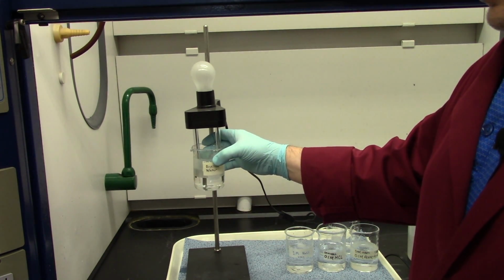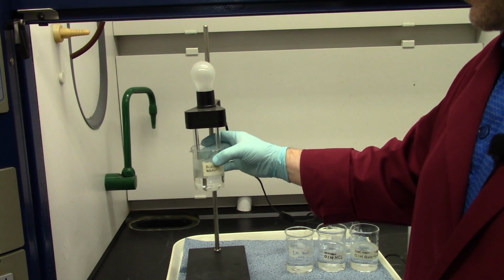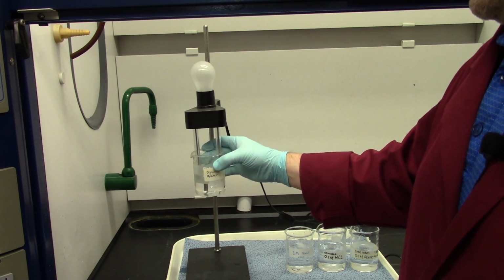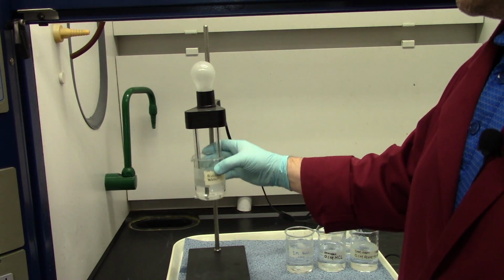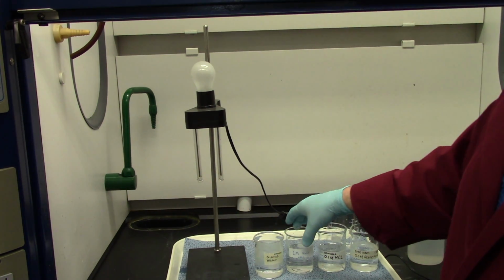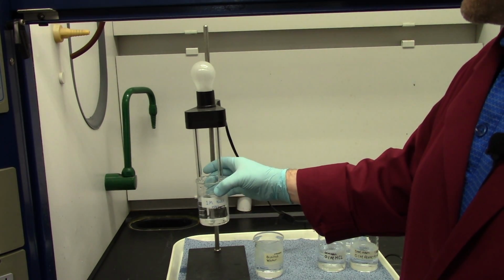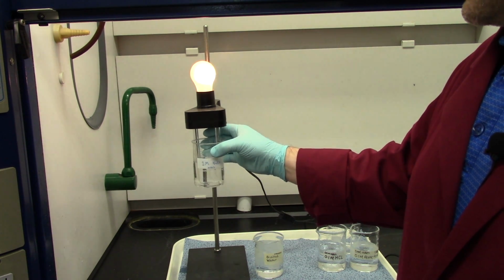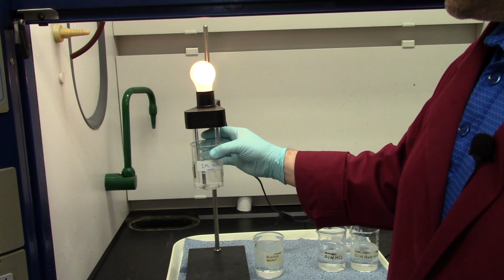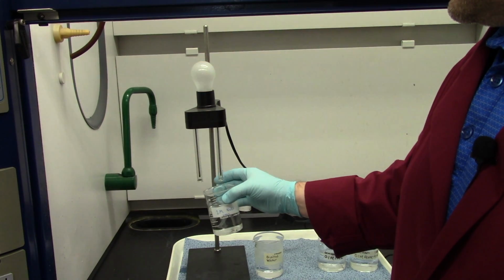Water, as you can see, by itself, doesn't conduct electricity, at least in this experiment, at all. Now, if you put enough energy through water, it will conduct electricity, but it takes a lot. All right, guys, so water is a non-electrolyte. Next, 1 molar sodium chloride. Let's see what happens. Oh, look at that. Bright, bright light. Sodium chloride dissolved in water definitely conducts electricity. It is most definitely an electrolyte.